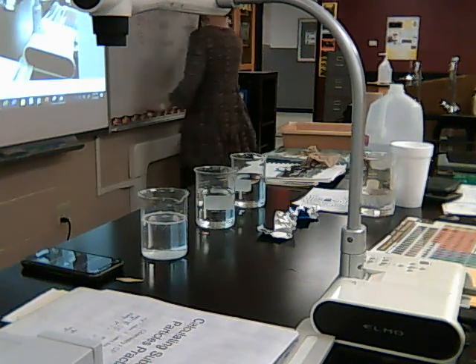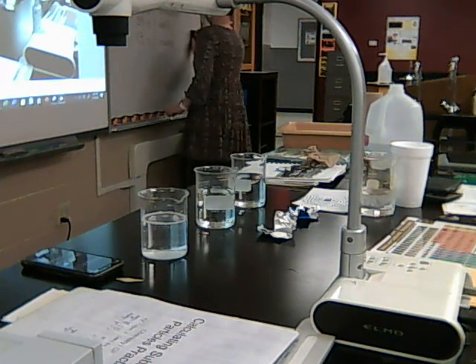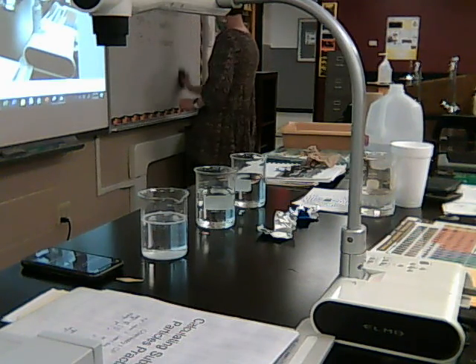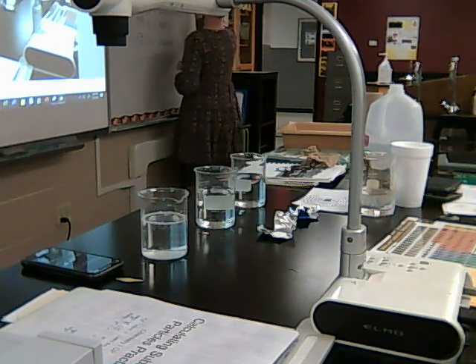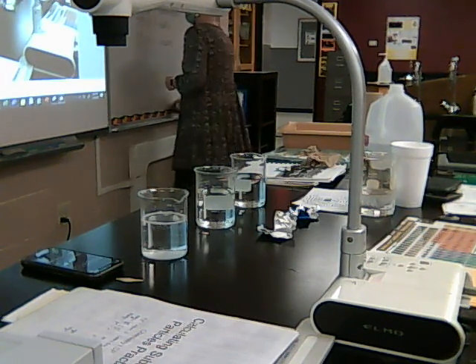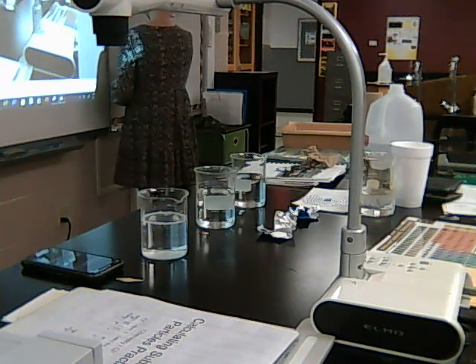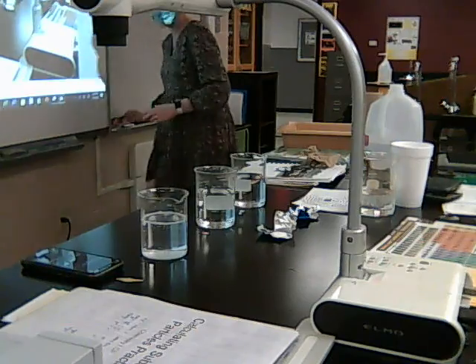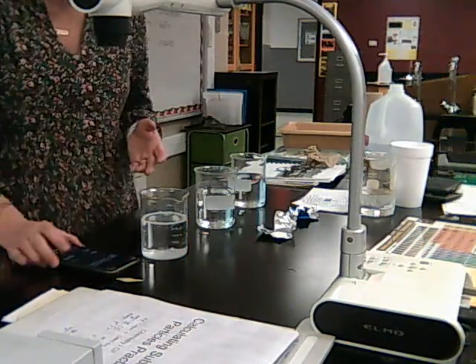So now, that's not an independent variable anymore. Room temperature for all of them. All are going to be room temperature, because that's just easier for us to do. So 59 seconds, is that what I said? 59 for the whole. Okay. Room temperature again, but this time we're going to do the halves. Let me reset this.